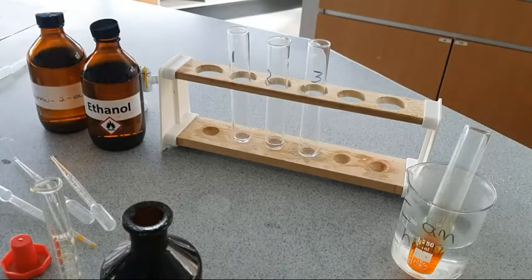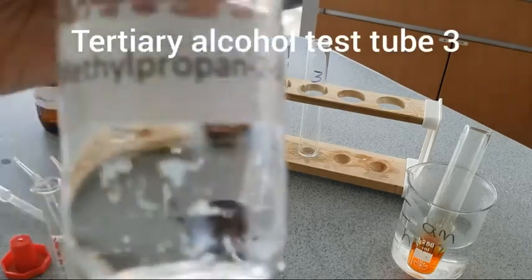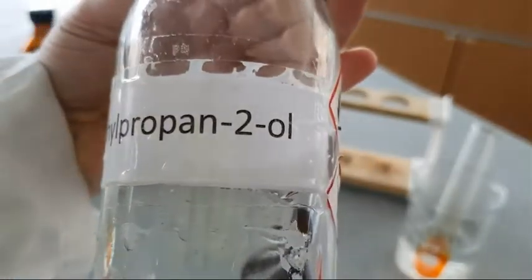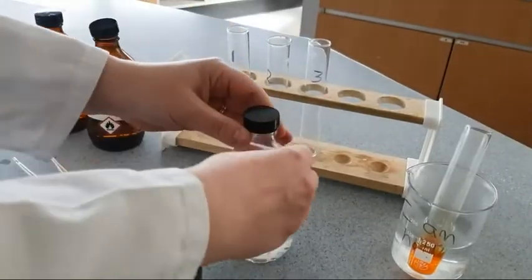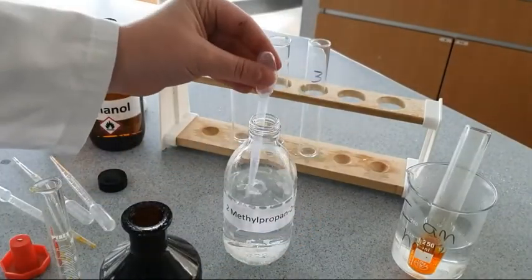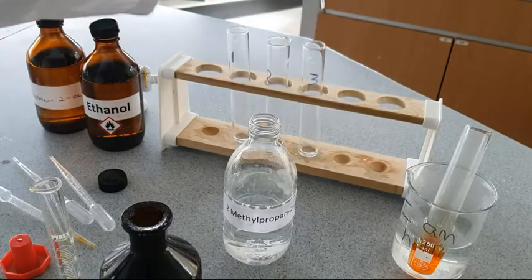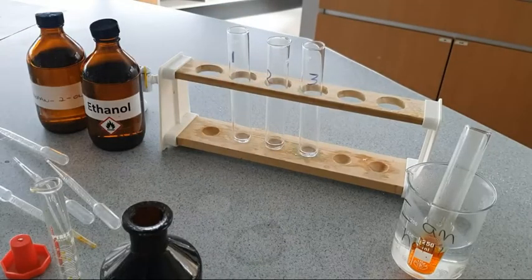And then in our third test tube, we are going to place some tertiary alcohol, which we're going to use for this experiment, 2-methylpropan-2-ol. The methyl group being on the same carbon as the alcohol group, this ends up with 3 R groups attached to the functional group carbon. This is a tertiary alcohol. So we've got a primary in test tube 1, secondary in test tube 2, and a tertiary in test tube 3.